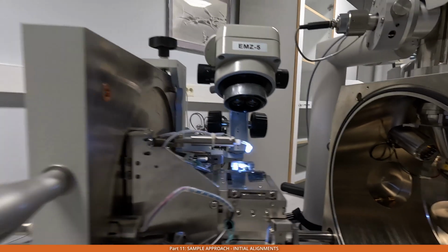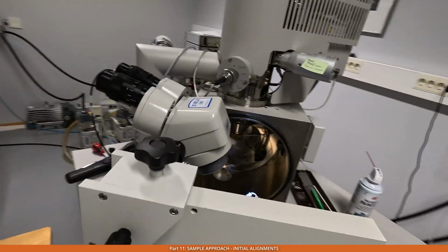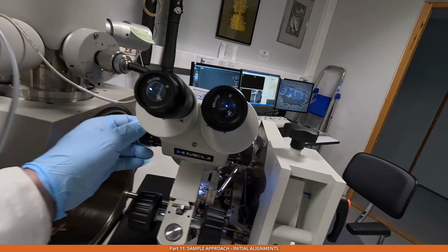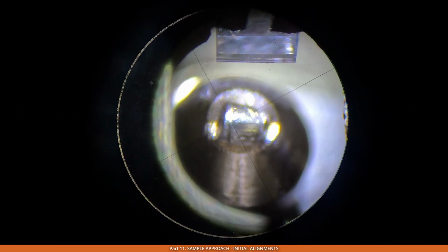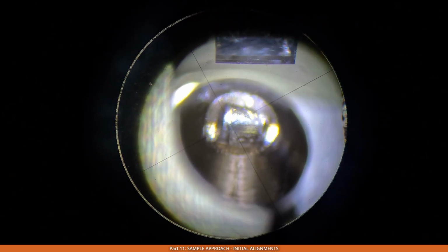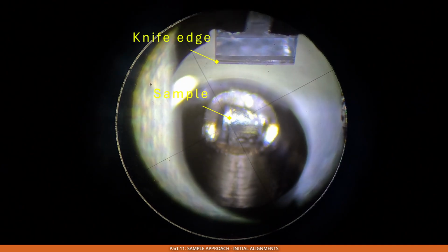Now we'll sit behind the stereo microscope and make sure that we can see the sample. We can change the magnification and then focus. Yeah, it's probably badly seen, but that's how it looks. You see the edge of the knife and the sample under it.